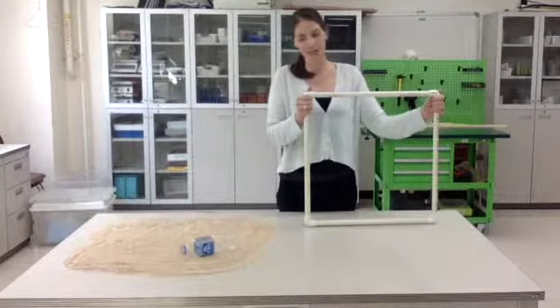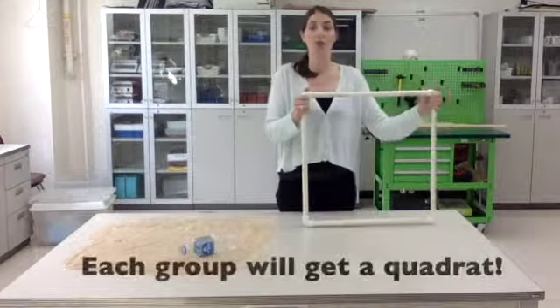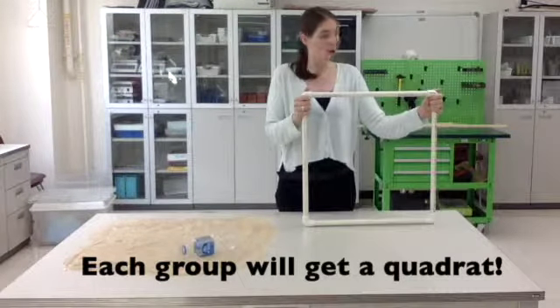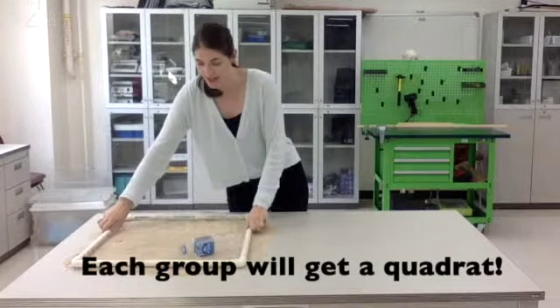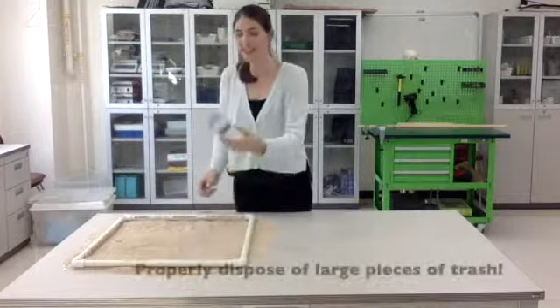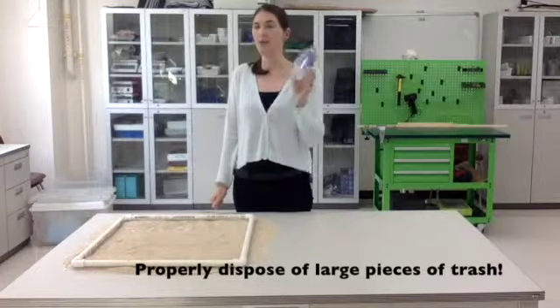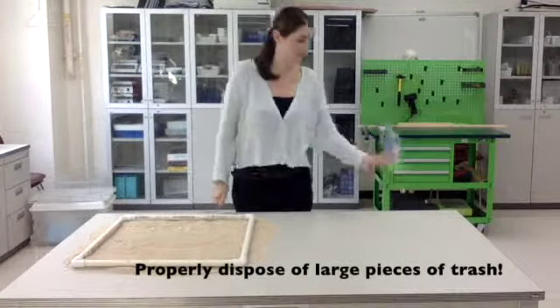Each of you will get what we call a quadrat, which is a known size. So we know the actual area of this quadrat, so all you need to do is place it on the area in which you're going to sample. So now you're ready to sample. But the other thing you need to watch out for are really large pieces of plastic, because those can go into recycling. We don't need them to add to the plastic trash problem in the ocean.